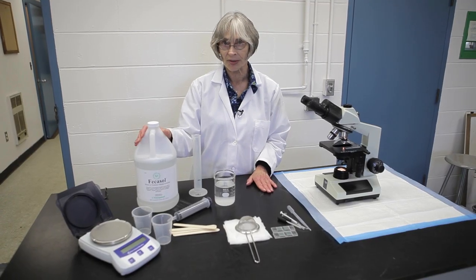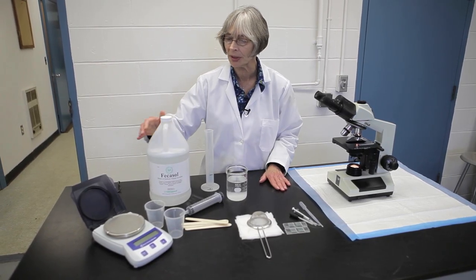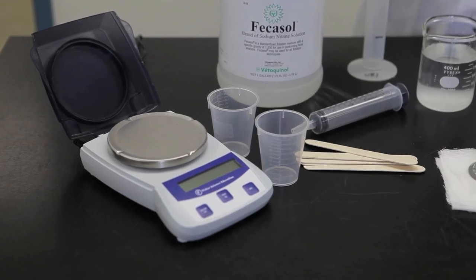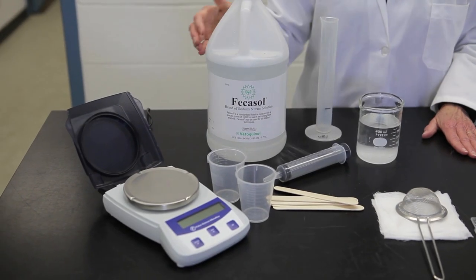Here are all the supplies you'll need to do your fecal egg counts. The first thing you'll need is a balance to weigh out your fecal sample — a standard laboratory balance or a kitchen balance found online, as long as it measures in 0.1 gram increments. That's the level of sensitivity you need. You can find reasonably inexpensive balances that give you that level of sensitivity.